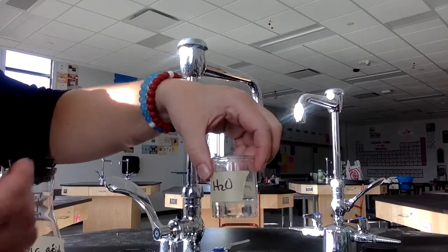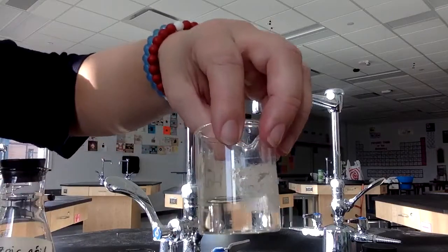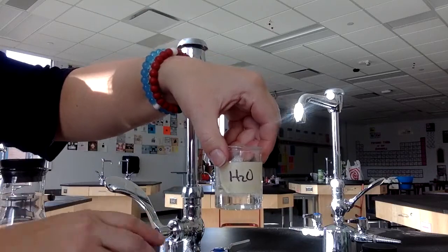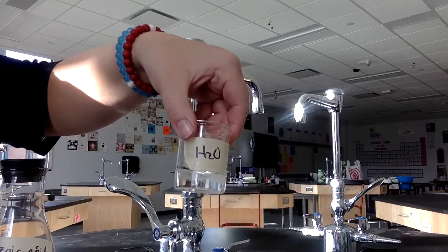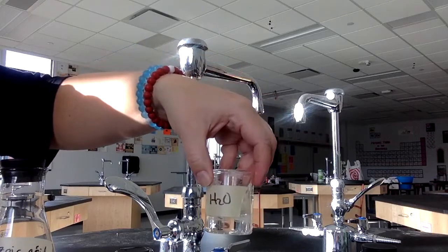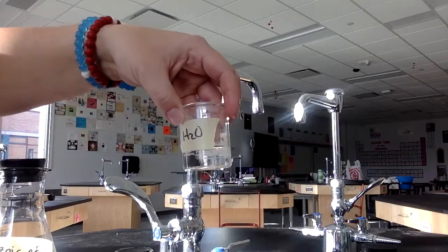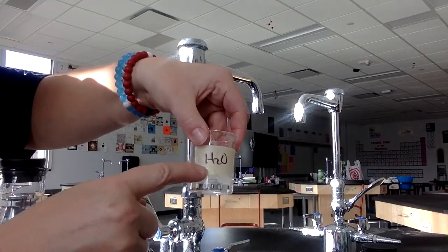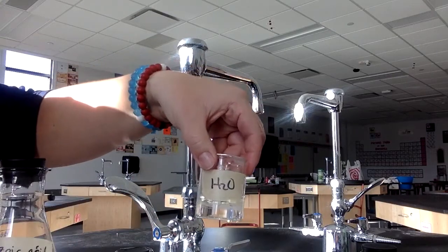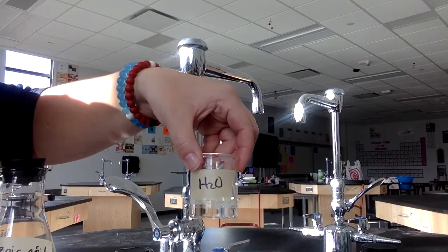So in terms of the space that it takes up, if you compare it to some of these other containers, it's really little. Clear liquid, because we know that's what water looks like. But when you get to compare it to some of these other samples, you'll kind of see what that means. So 1 mole of water, it's about 18 milliliters is how much space it takes up, kind of a clear liquid. So different than all of the other ones, but kind of just to give you it. So for your mass of your sample, you'll need to add up 2 hydrogens from the periodic table plus 1 oxygen. And then because it's H2O, you'll have to make a decision. So is that an atom, a molecule, or a formula unit?